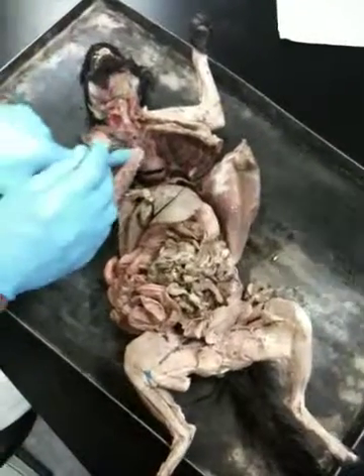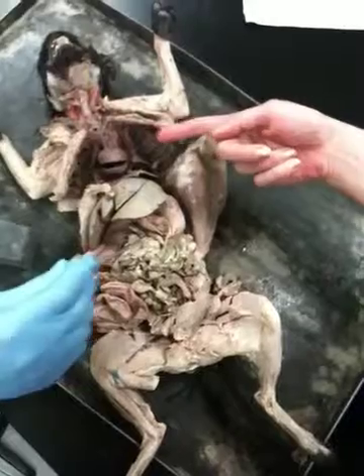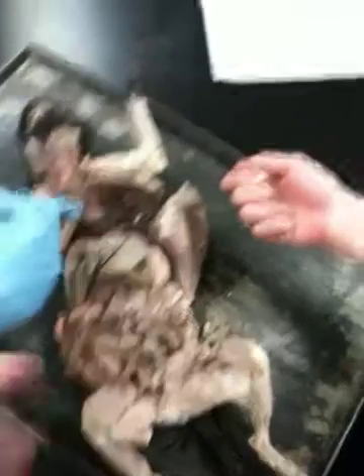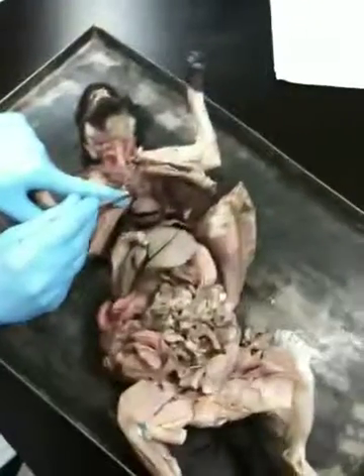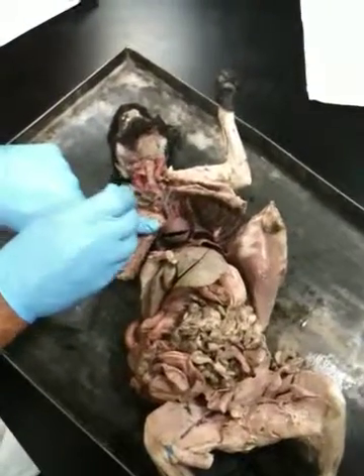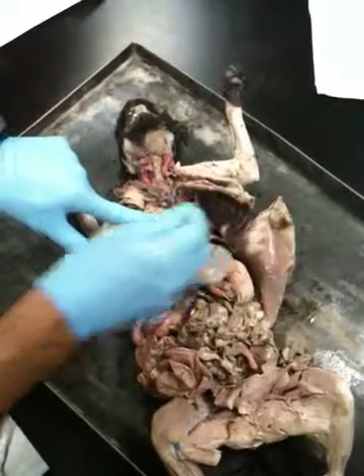Okay? You said superior mesenteric? No, superior mesenteric was here. You meant brachiocephalic. This is the superior vena cava, right? Yeah. Superior vena cava turns into two brachiocephalic. This is the right brachiocephalic, this is the left brachiocephalic.